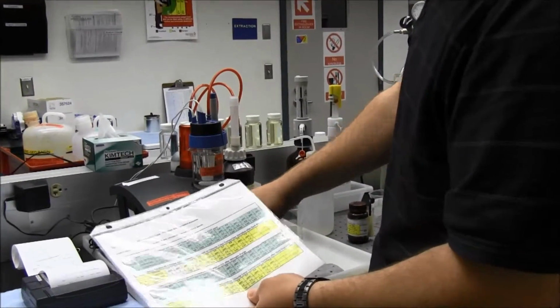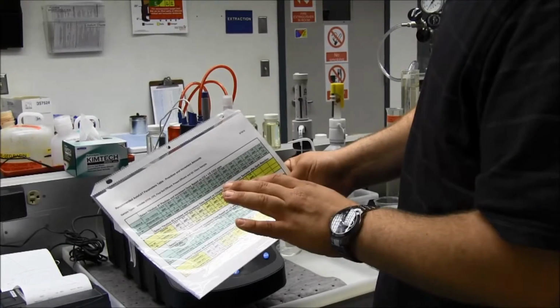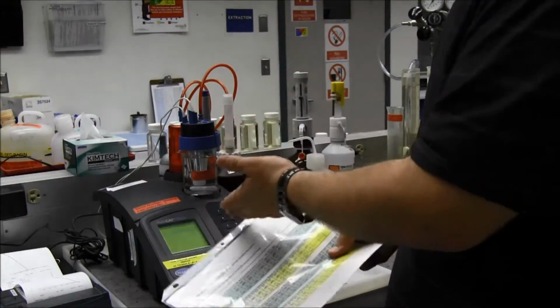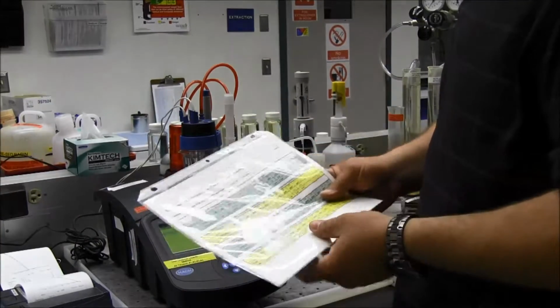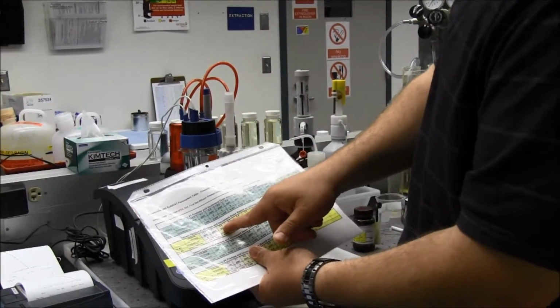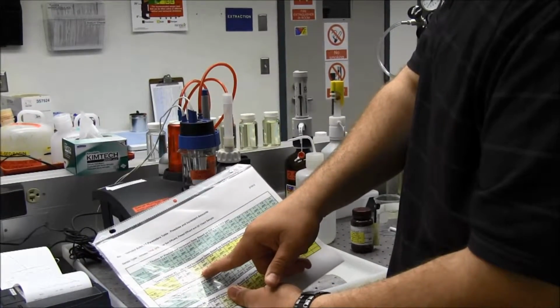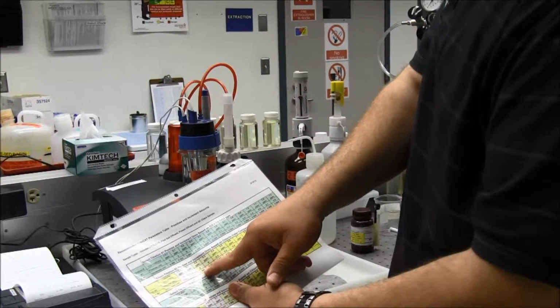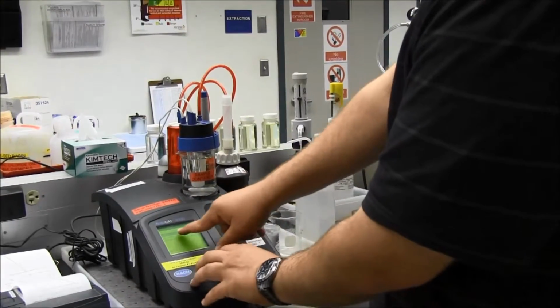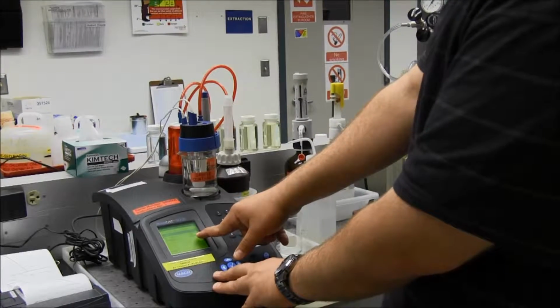My pre-dose parameters, I'm always going to undershoot it a little bit, because what happens is that you can't really underdose this, but if you overdose it, then you'll throw the test off. So what I'm going to do is bring it down to, say, a 0.2, which would be a pre-dose of 0 and an increment of 0.005. So my pre-dose is set at 0, my increment is already set at 0.005.